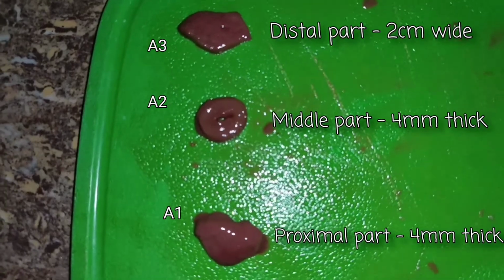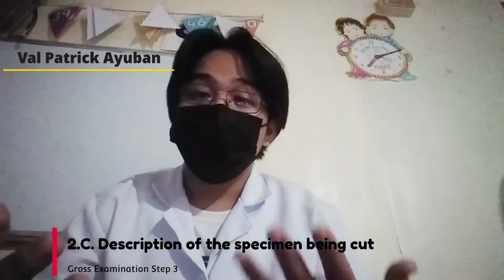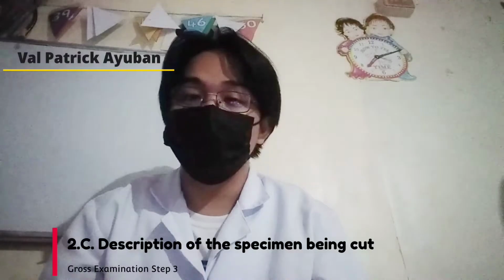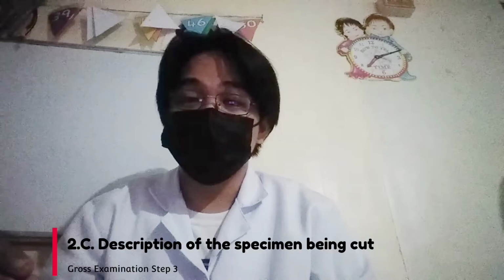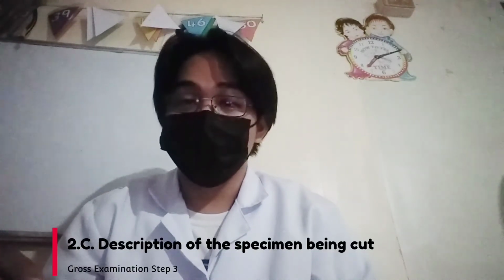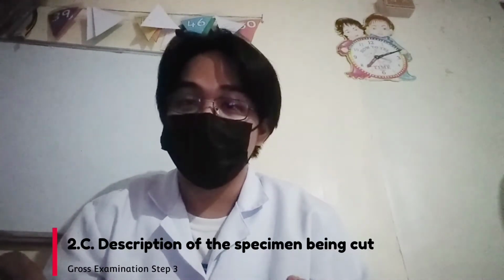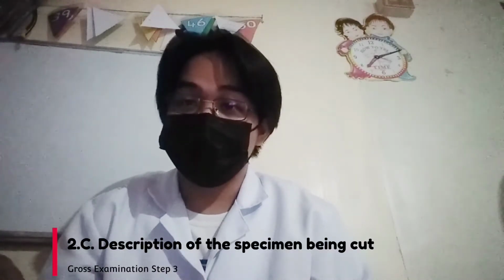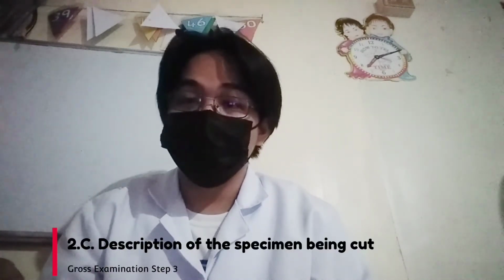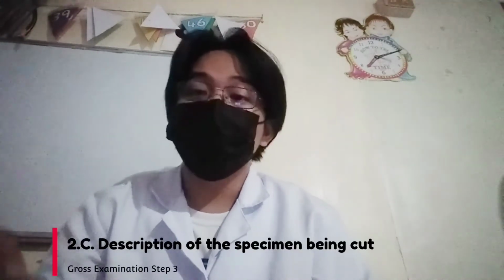The sectioning reveals a tan red to brown mucosa with flat formation and tissue fluid. Proximal cross-section A1 length is 4 mm. The serosa is pinkish red and smooth, with no presence of perforation. Cross-section A2 shows a lumen approximately 0.1 cm in diameter with no granular materials. Longitudinal section A3 length is 2 cm. The mucosa is pinkish red with a smooth surface.